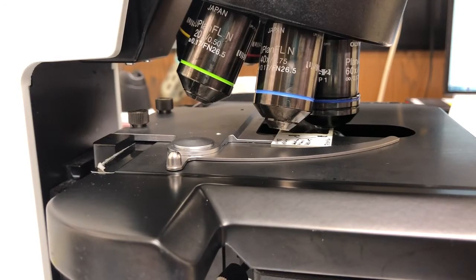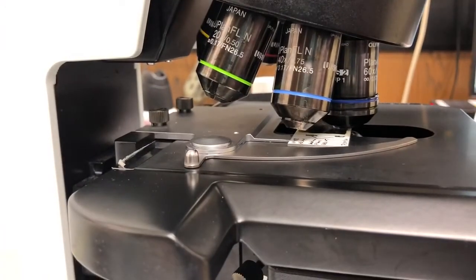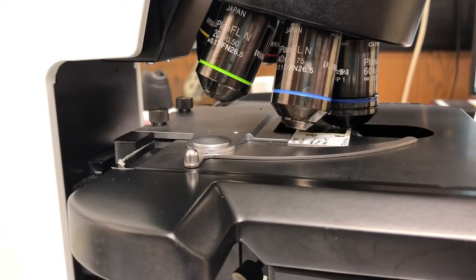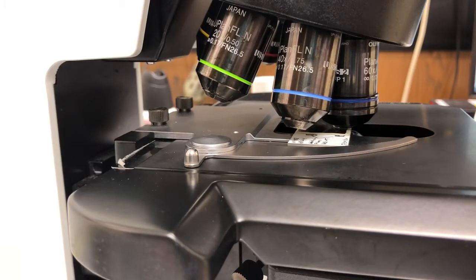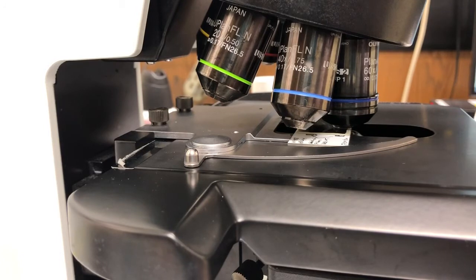One of the things that you should keep in mind is when you're switching between objectives once you've gone on to the oil you should always hit escape to leave some room before switching and you should not use the 40x objective anymore because that objective gets so close to the sample that it will likely be contaminated with oil and to an extent I would recommend you don't use the 20x either. So once you have oil it's sort of a one-way trip. If you want to go back it's best to clean it off because else you'll get the other optics on the microscope dirty.